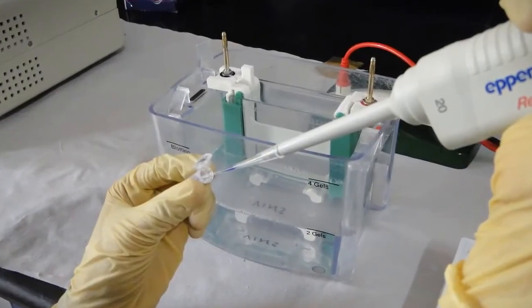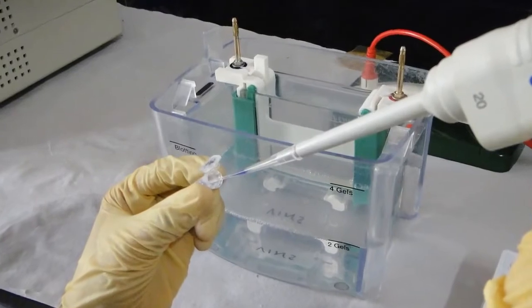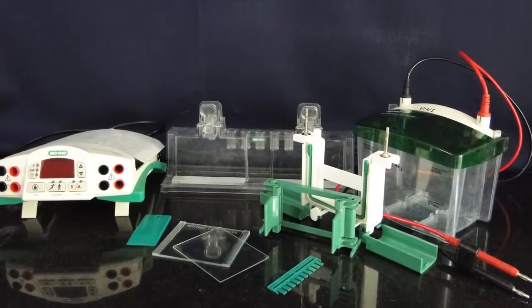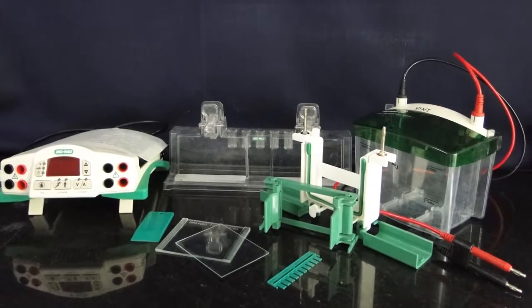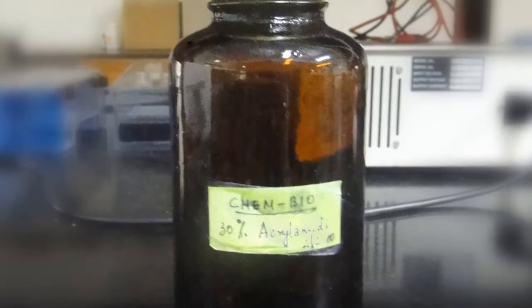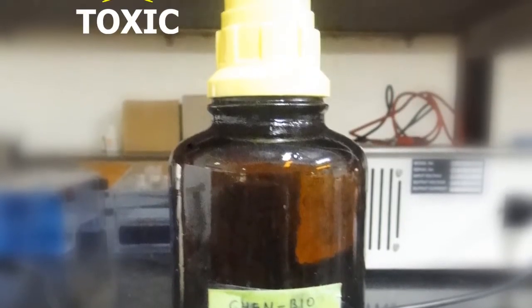Caution: Wear gloves at all times while performing SDS-PAGE. To ensure proper alignment and casting, the glass plates, spacers, combs and casting stand gaskets must be clean and dry. Pay special attention while using acrylamide as it is a neurotoxin.